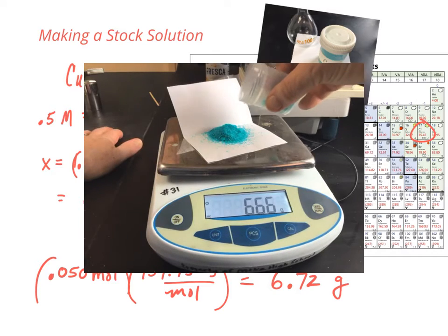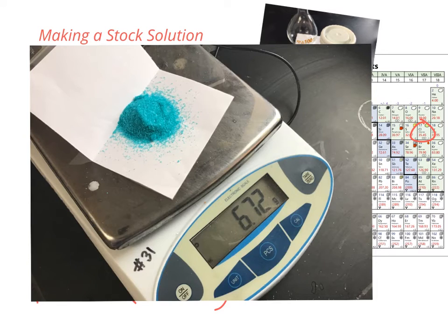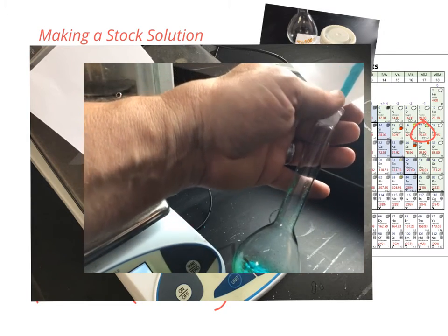All right, getting close, 6.66. And there we have it, 6.72 grams. We add this to our volumetric flask.